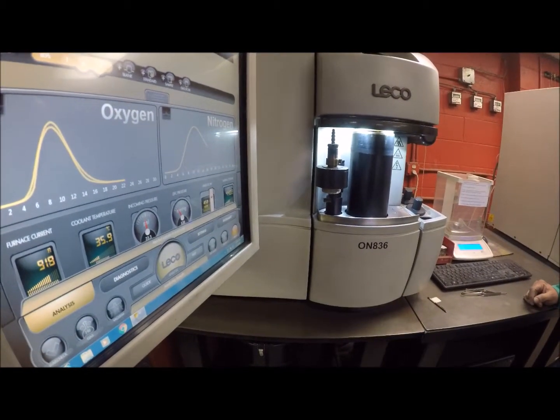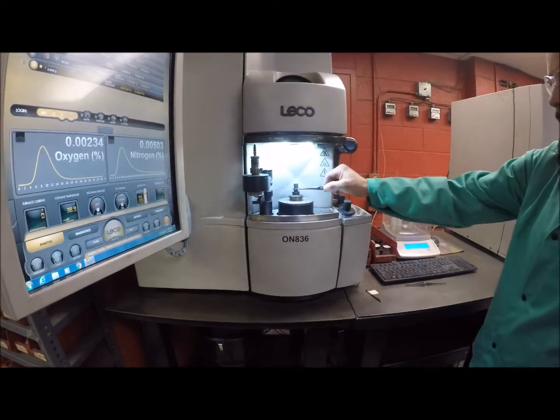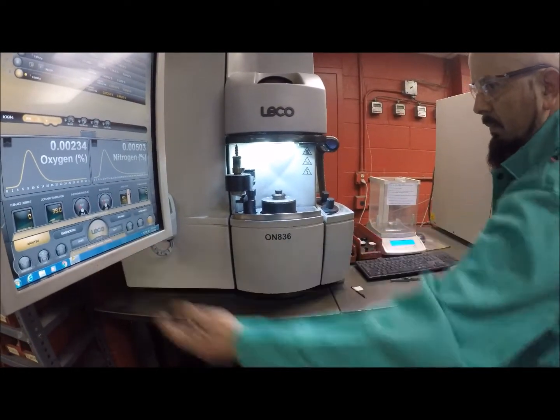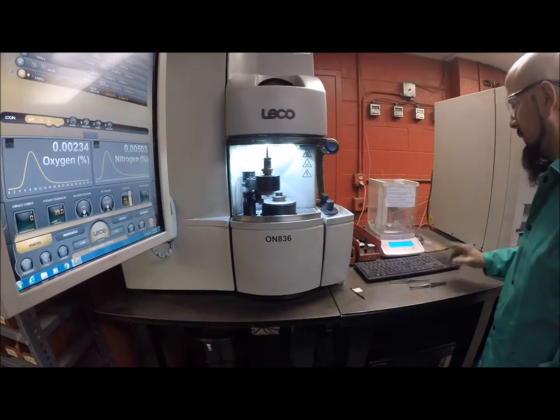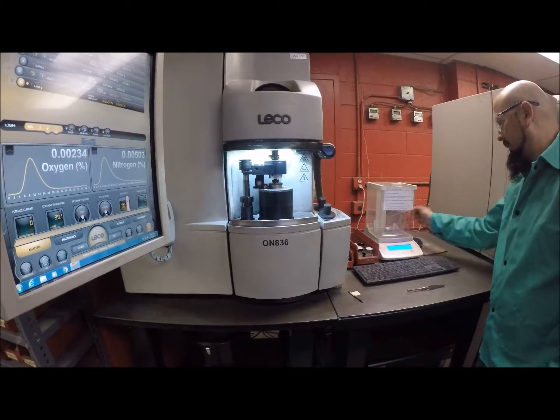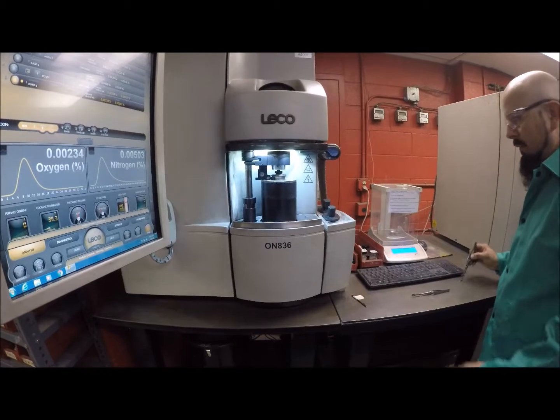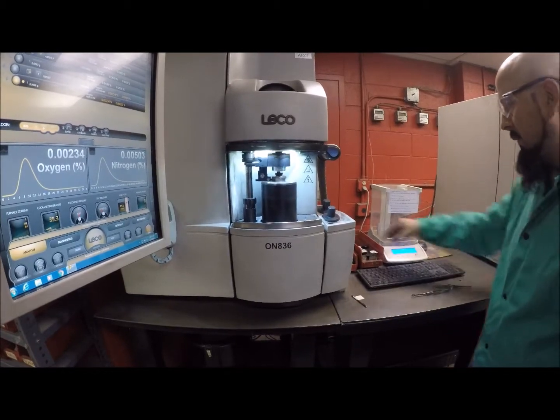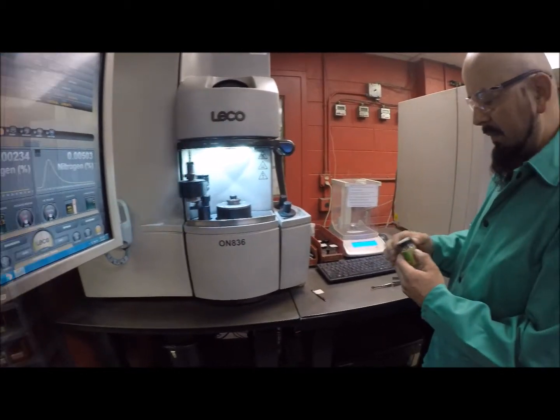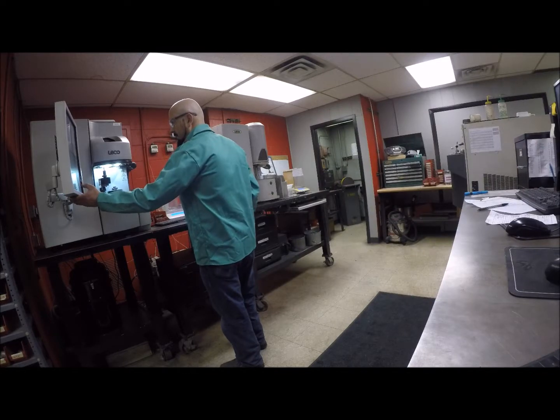Examples of duplex alloys include CD4MCuN, CD3MN, and CE3MN. In other grades of stainless steels, including precipitation hardening and martensitic grades, nitrogen is typically not desirable and excess amounts can result in casting quality problems. For these alloys, nitrogen is monitored to avoid quality issues.